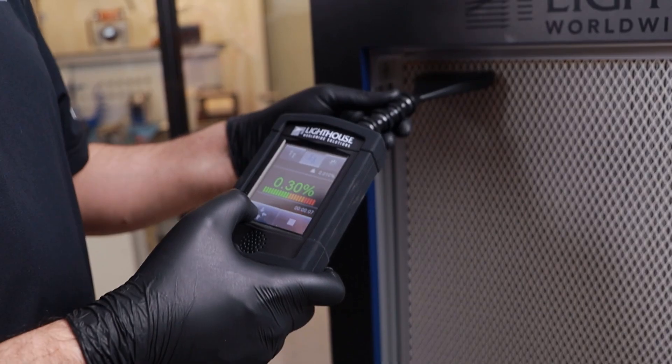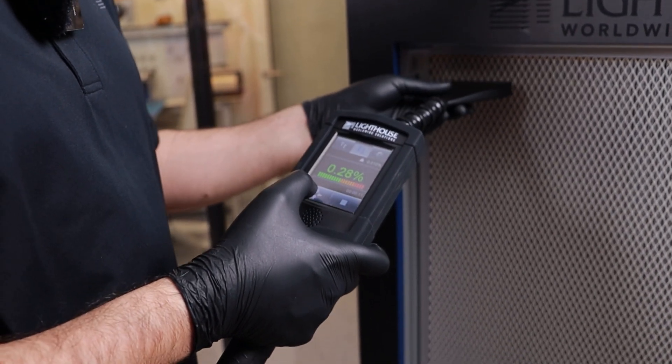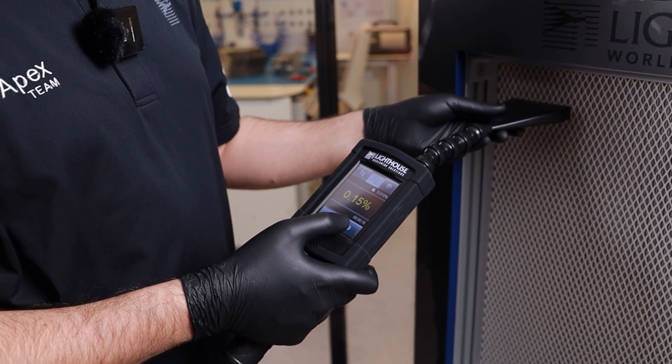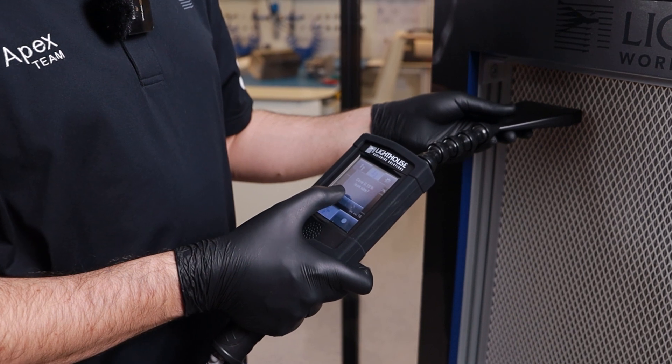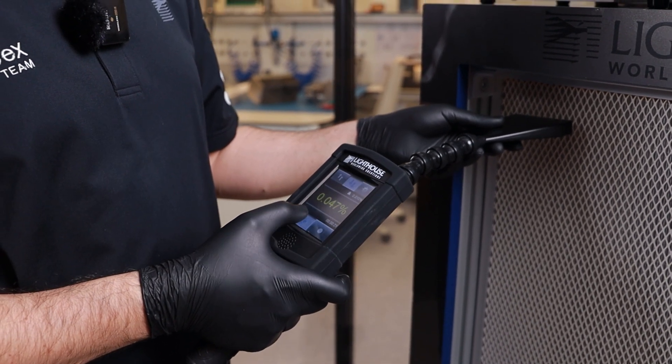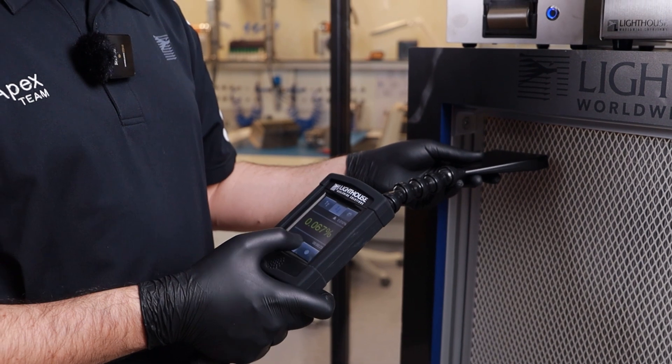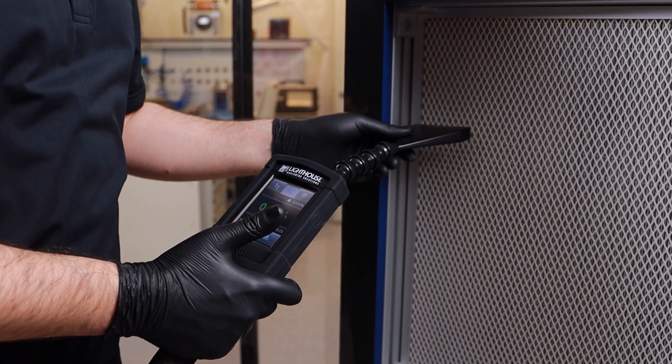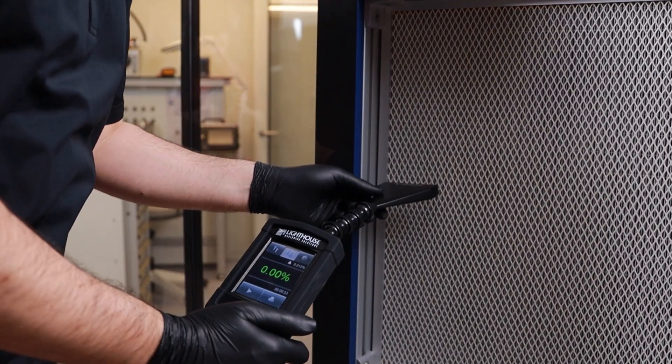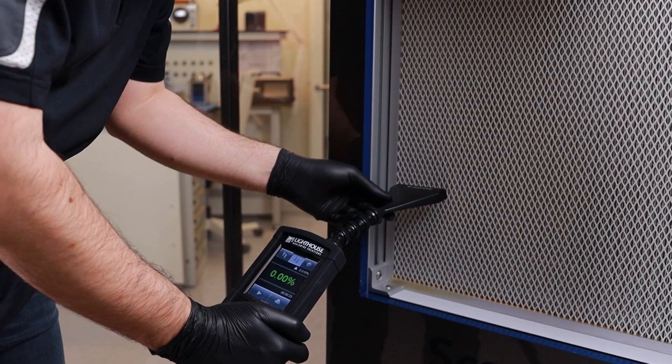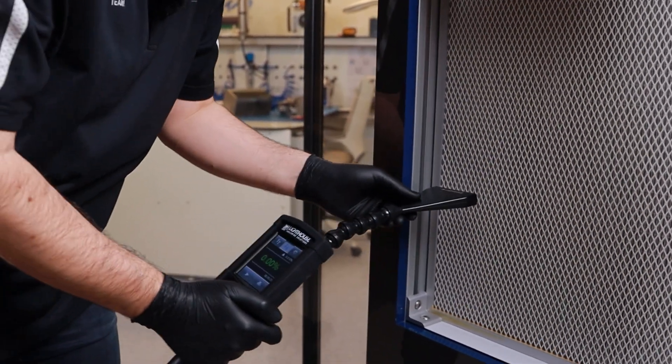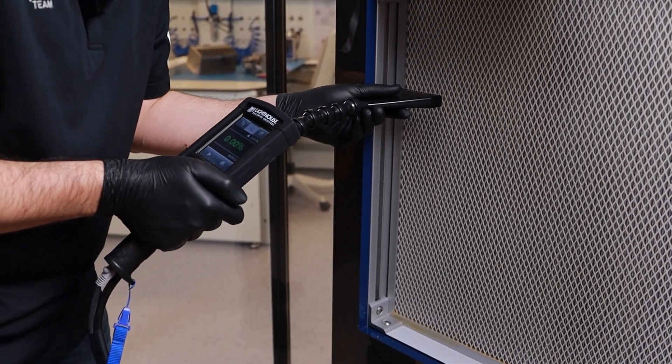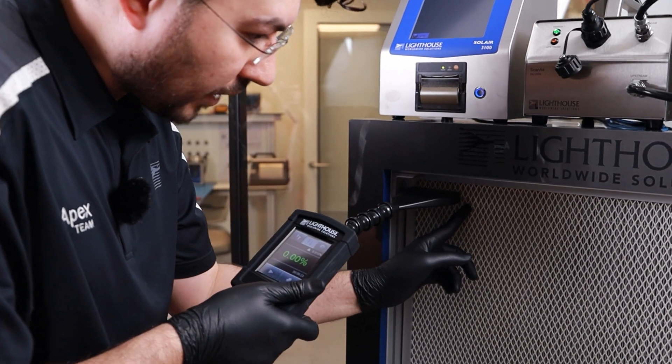If you find any leakage like this while you're scanning, you stop in this area, move slowly and the slow mode starts and record it. So this leak was recorded into my system. So I can keep running on that way and I can scan all the surface of my filter. 5 cm per second is the best practice to move. Don't wave around. Don't take it in and out.